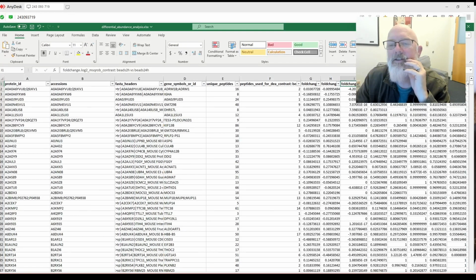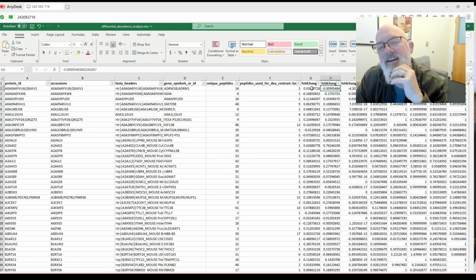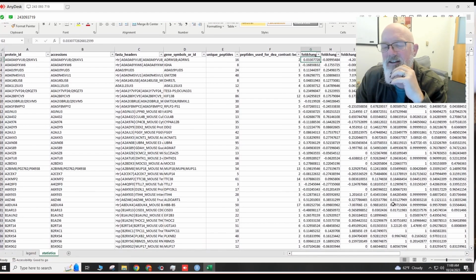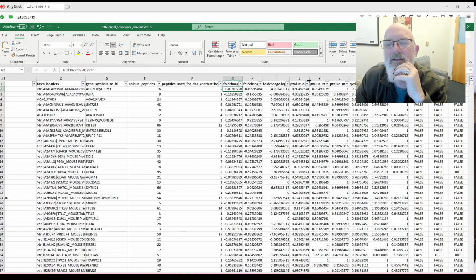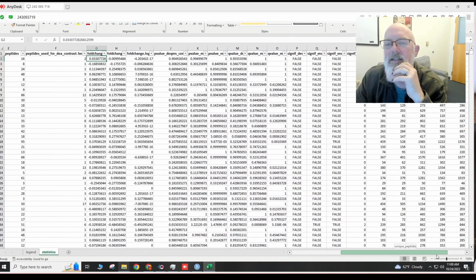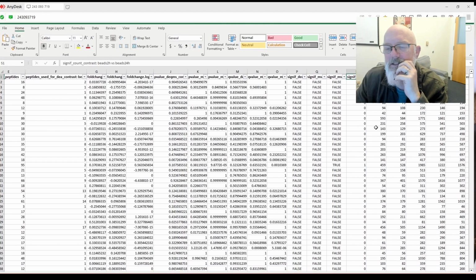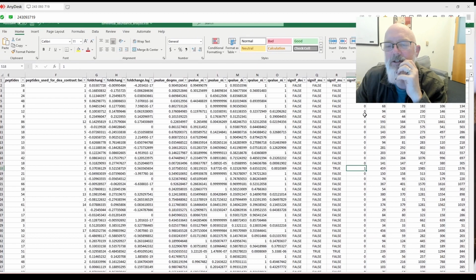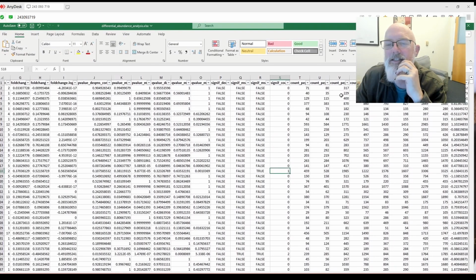And that is a big difference, isn't it? 4 times 10 to the minus 17th versus that one. So that's a big difference. So let's see. And here's the p-values. And then it has a nice indication of whether they were significant for each algorithm, significant count. Oh, so this is the number significant count for the 3 algorithms. Oh, that's nice. That's nice. I like that.